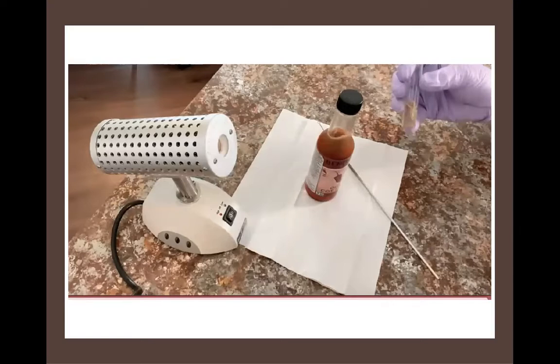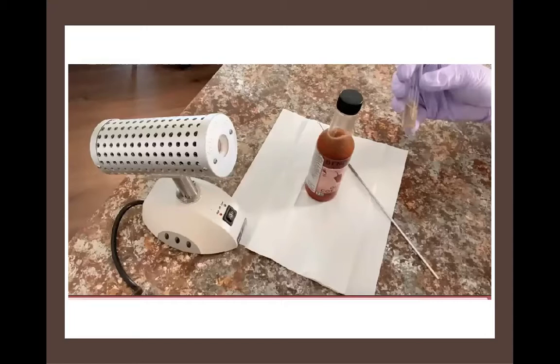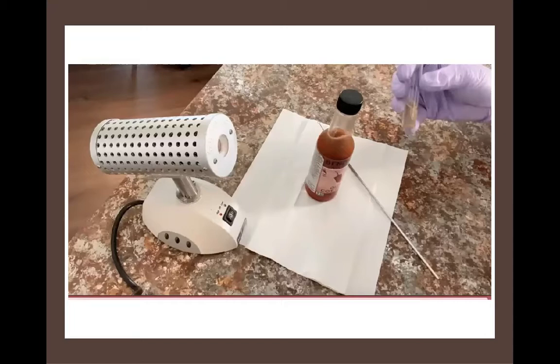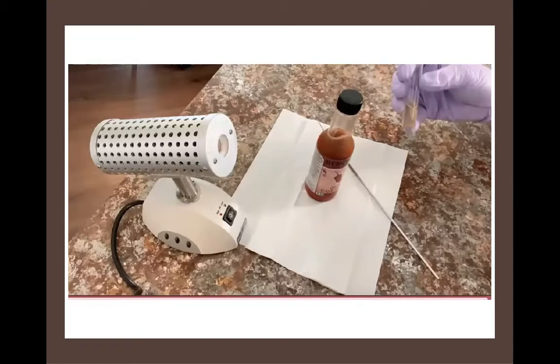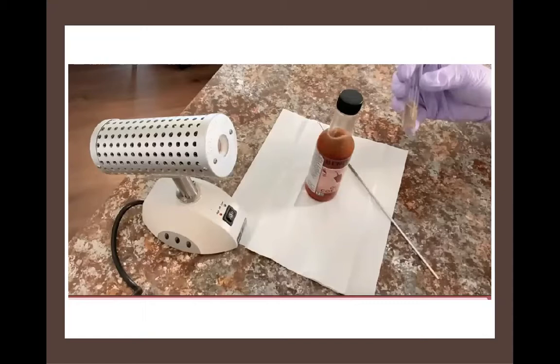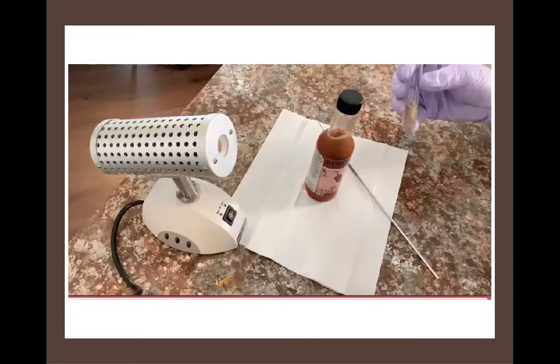When working with a glass test tube, we can take an extra step to protect the sterility inside the nutrient broth tube: flaming the mouth of the test tube when we open it, before we put culture material in, and also flaming it again before we close it. This is something we can do using aseptic technique to add an extra layer of protection against contamination. People don't always flame glass test tubes because it can be time-consuming, but it is an extra layer of protection against accidental contamination. You would never do this with a plastic test tube, of course, because you would melt the plastic.